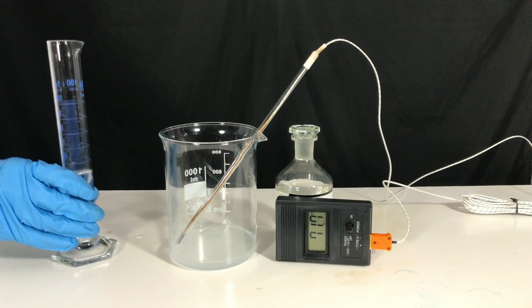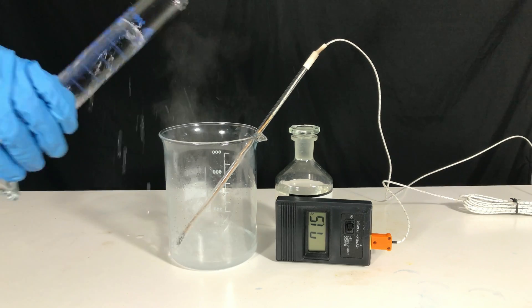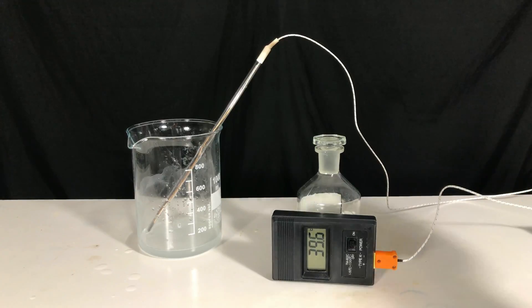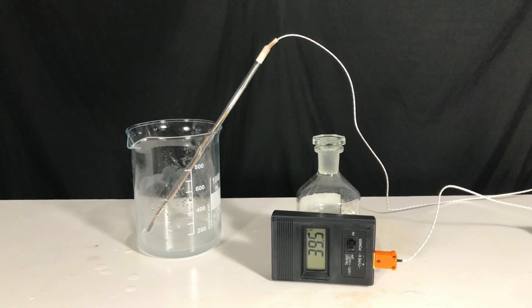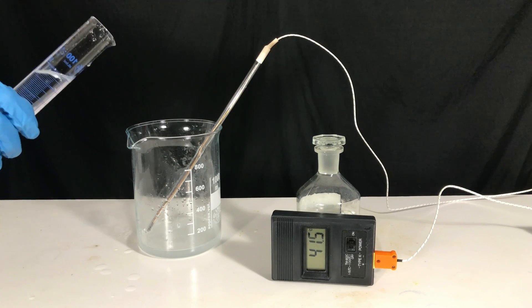If you don't dilute it, you will end up doing the same mistake as I did. Hot sodium hydroxide and concentrated acid. However, if diluted and the acid is added slowly and into cold sodium hydroxide solution, it won't be that bad.